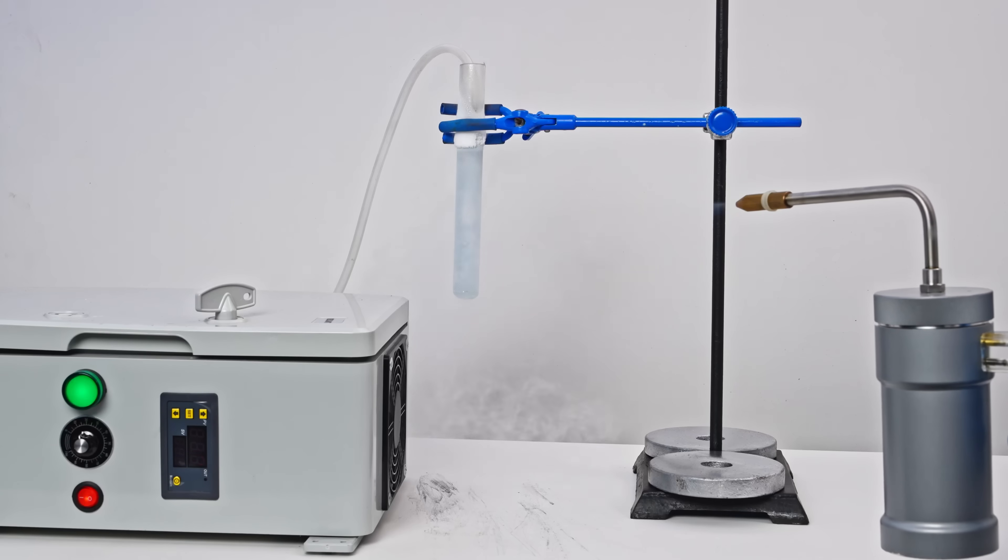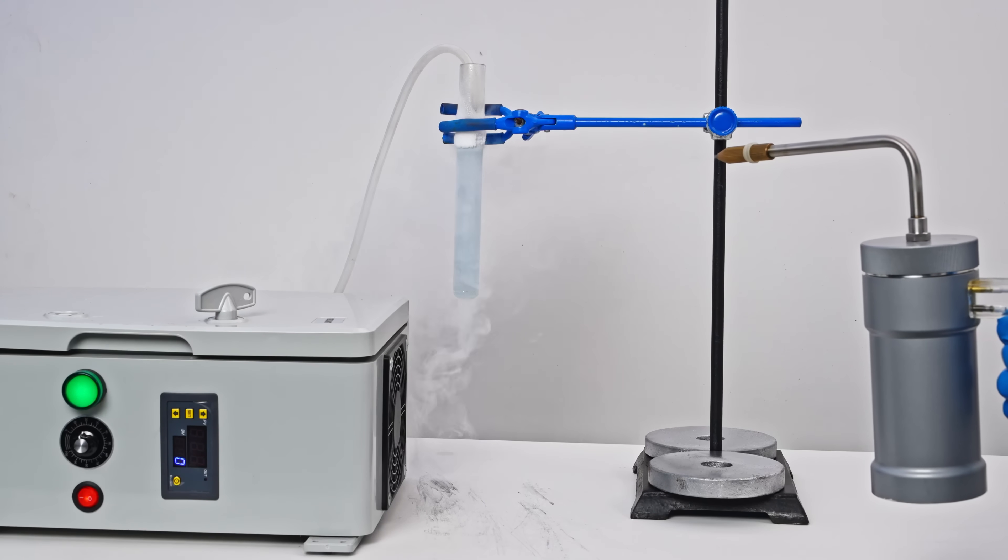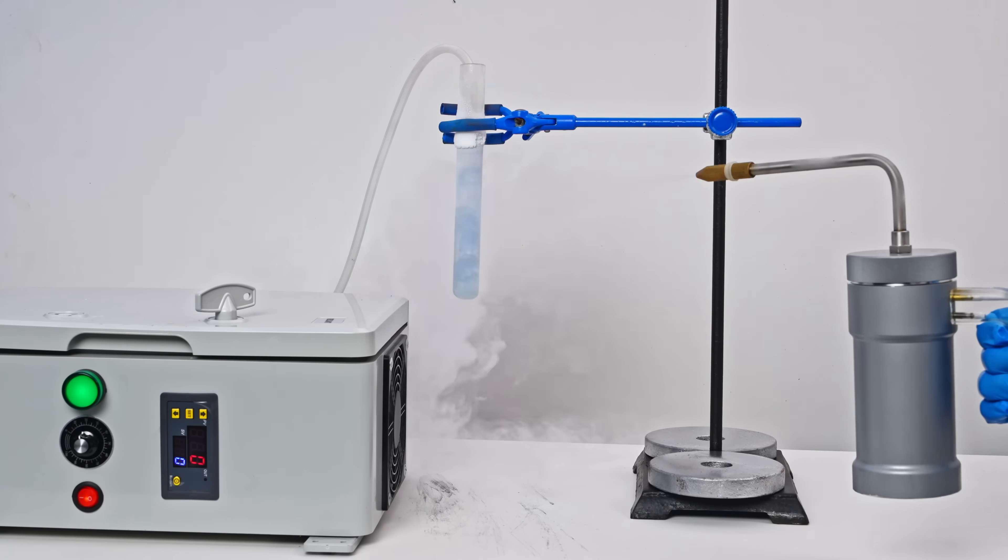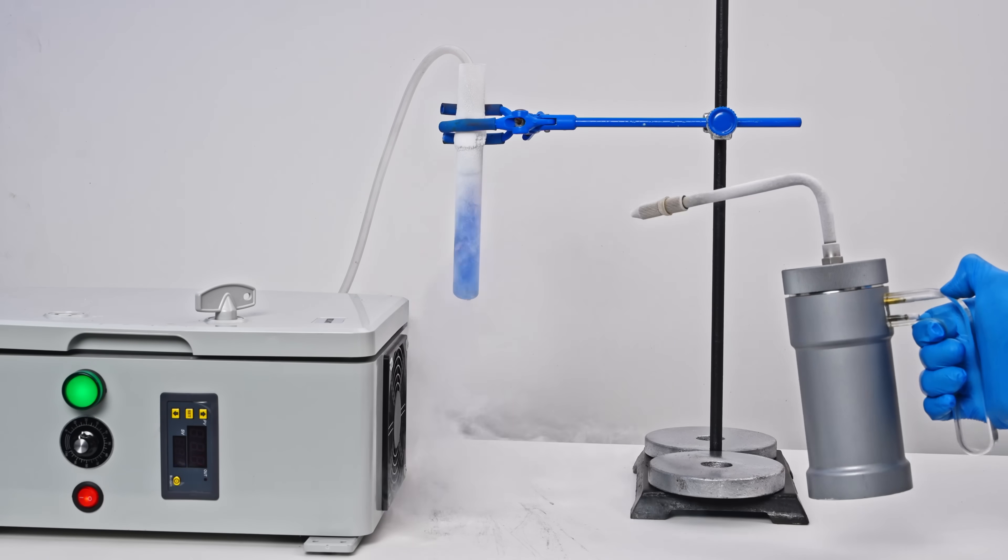Liquid nitrogen cooling prevents the oxygen from boiling and increases the amount of dissolved ozone, making the solution a deeper blue.